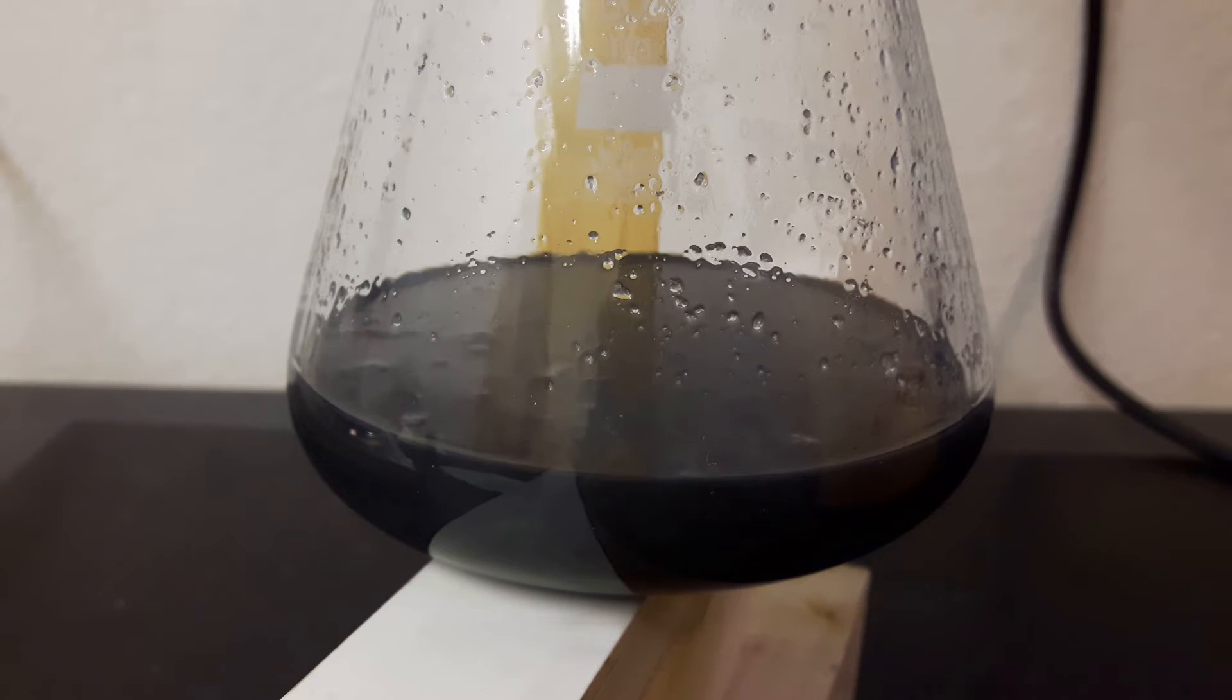So you have to run this until it looks something like this. And I took it off the hot plate and waited for it to cool. So now the first fail occurred. I thought it might be a good idea to filter this through. To get rid of the bigger aluminum pieces that are flying around inside.